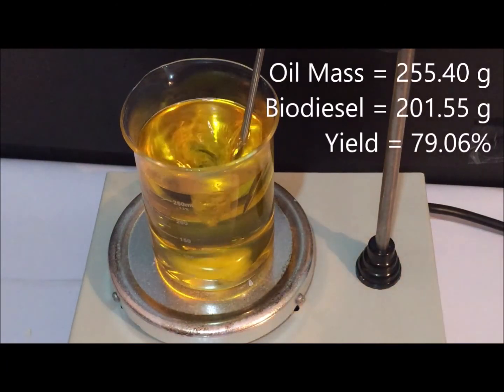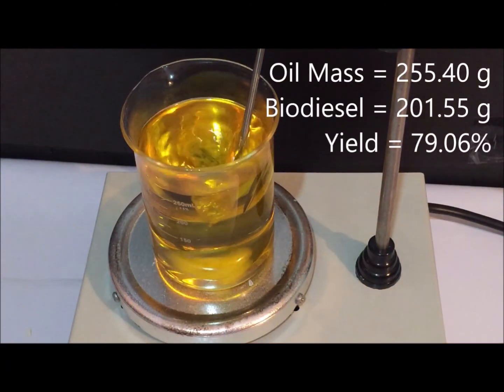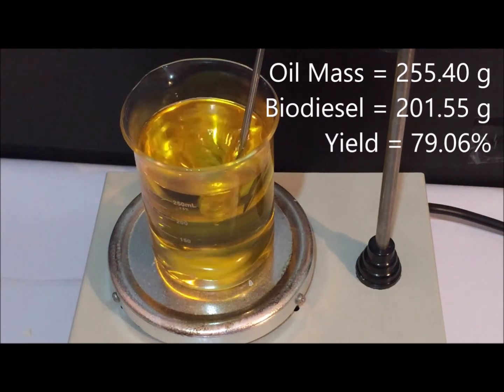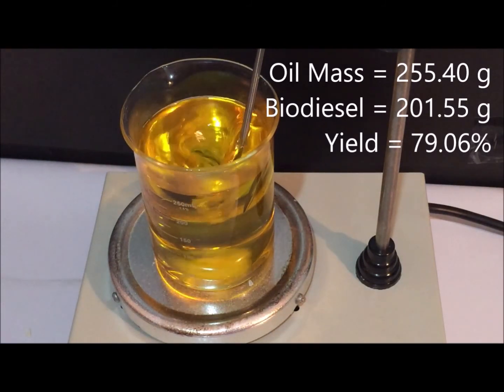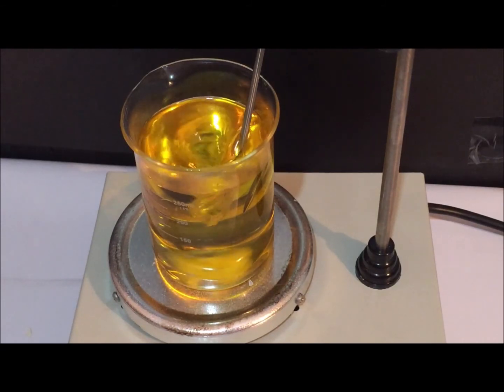In total, I used about 255 grams of oil and was able to produce a 201 gram sample of biodiesel, which approximates to a chemical yield of 79%.